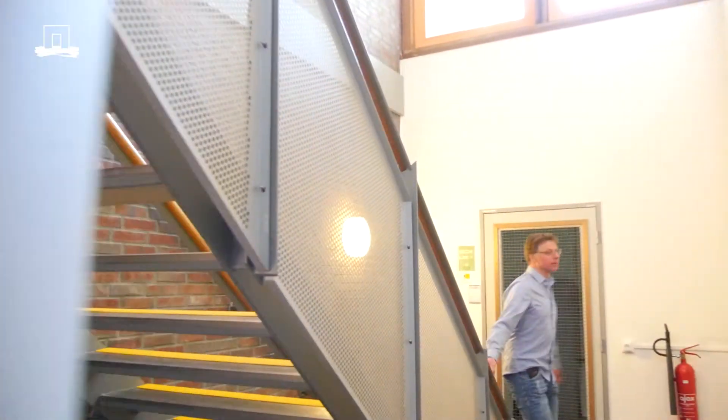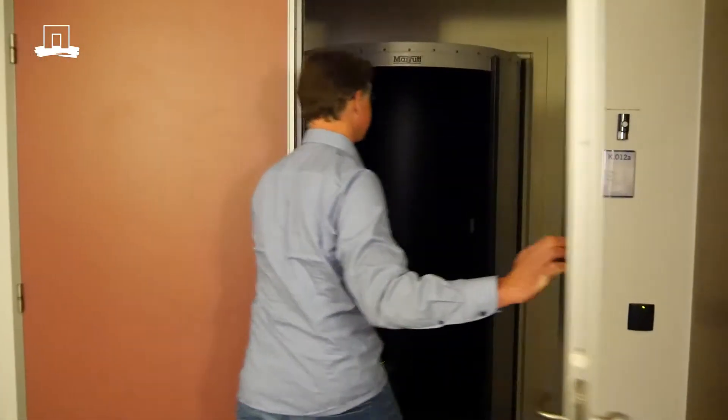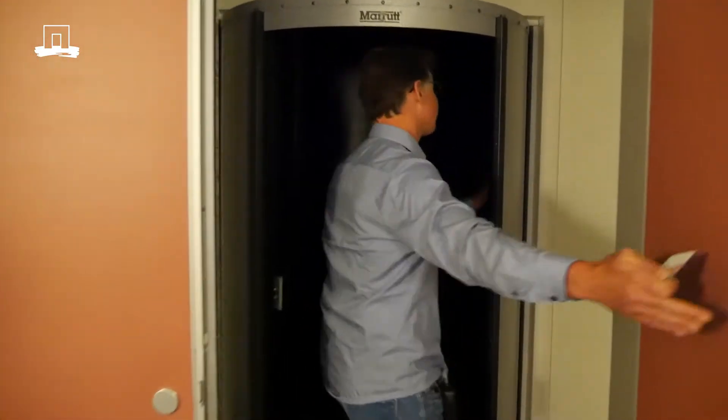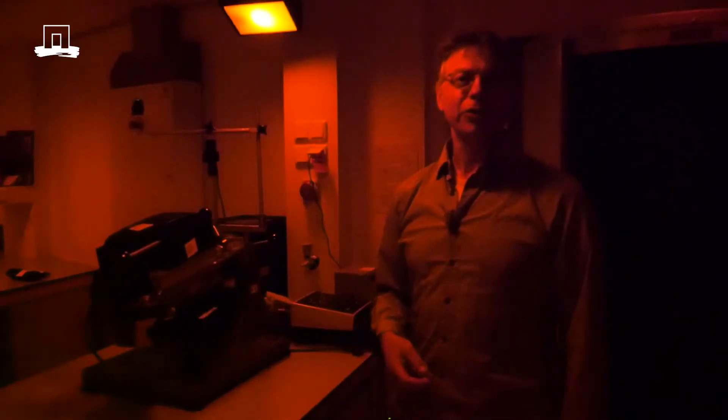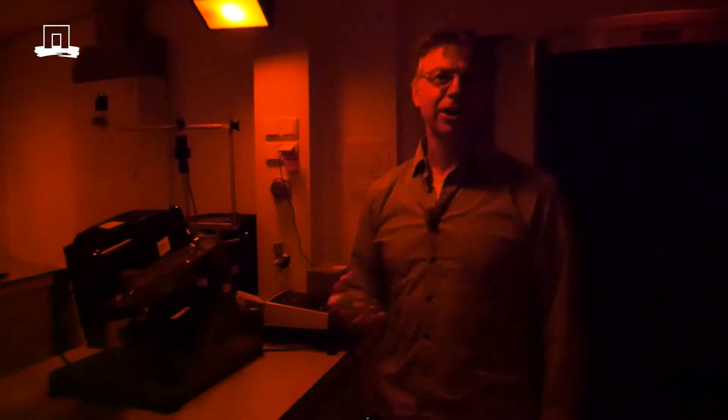The Luminescence lab is based in the basement because we don't need any light. In fact, it's a darkroom environment so I have to enter through a special door. Luminescence Dating determines the last exposure to light of sand grains, so we have to treat these grains in a darkroom environment to prevent them from losing their signal.